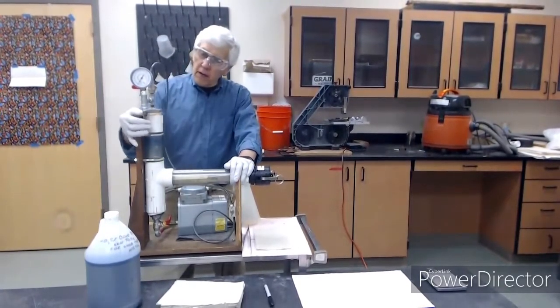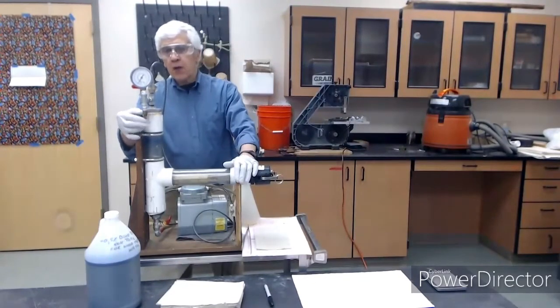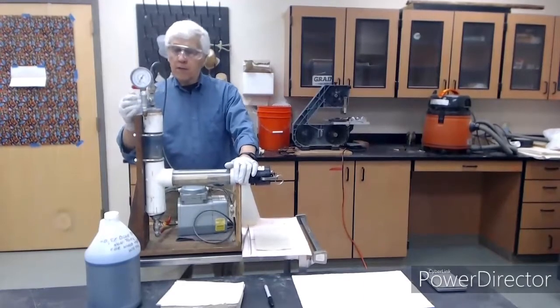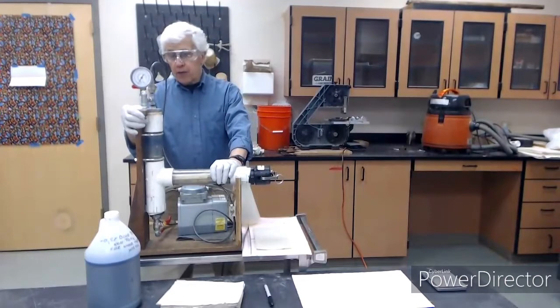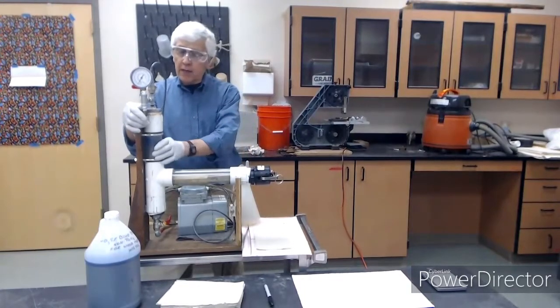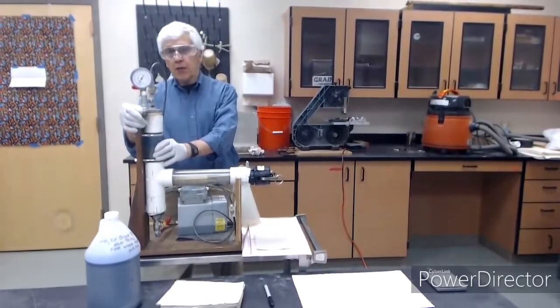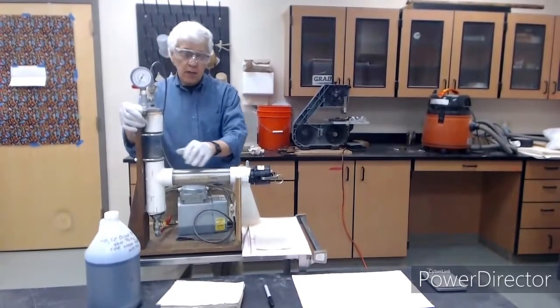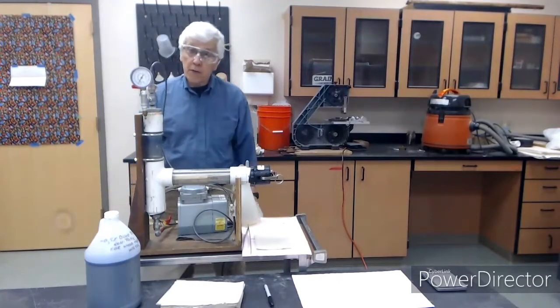We have another valve here. You just push it, and it will release either the pressure or the vacuum coming through this valve or pipe. So we hold the vacuum for 5 minutes, and then we release it. As we fill the cylinder's full, the gauge tank's got fluid in it. We release the vacuum, and we apply pressure. We'll apply pressure for 5 minutes, and then we will stop everything, drain the cylinder, and remove the wood and see what we've got.